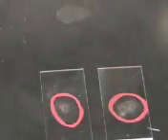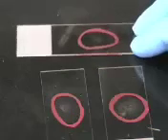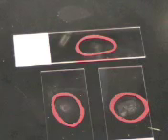Another thing you don't want is too little bacteria. You can hardly even see that there's anything on there, and even if there is, it's just right in the center of the slide, so you want to have it a little more spread out, just a little bit more bacteria.